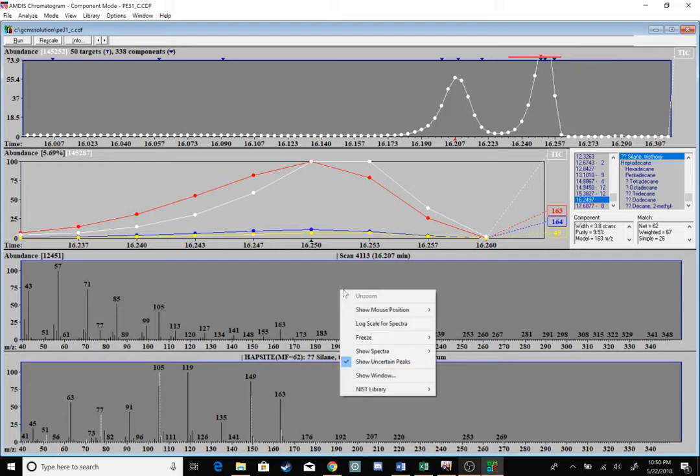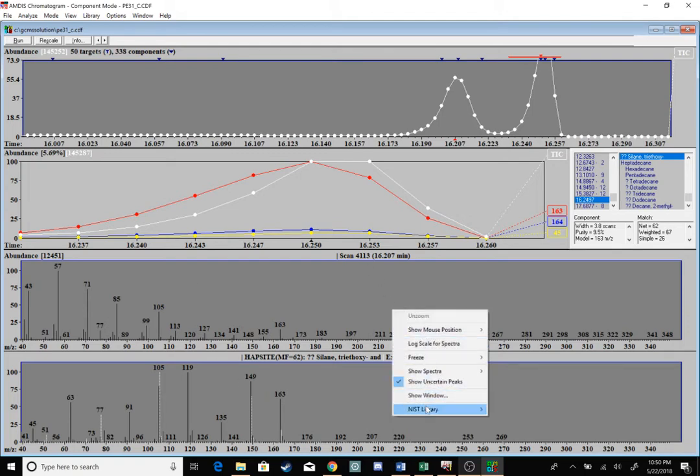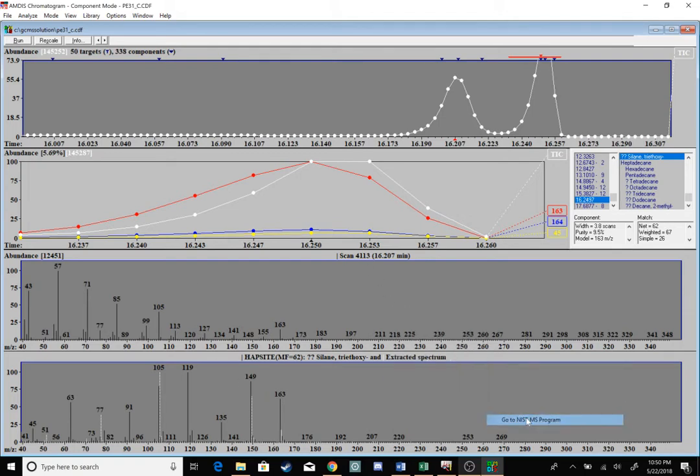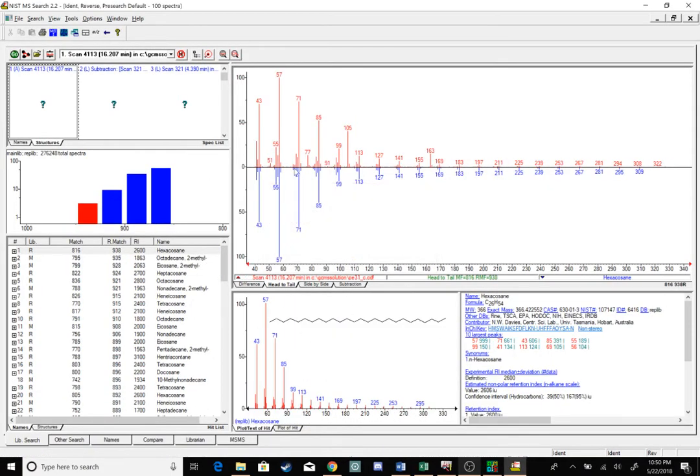To do that, I can right click my mass fragments, go down to NIST library, and then add that scan to my NIST library. I'm going to right click that same pane again, go down to NIST Library, and then go to NIST MS Program. It'll take a few seconds, but this should open the NIST MS Program, and I should see my mass fragments pop up. If your mass fragments do not pop up, you might try to hit this Go button, and it'll just start the import at that point.